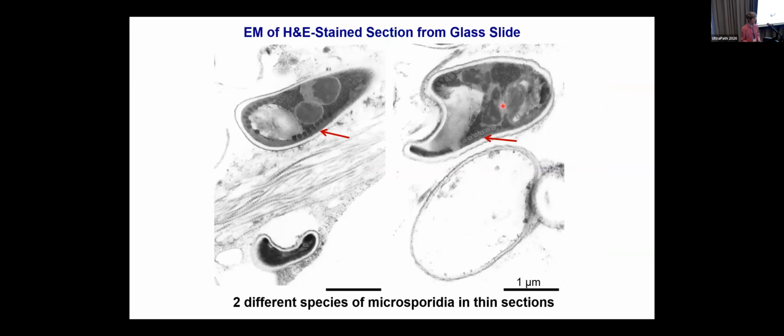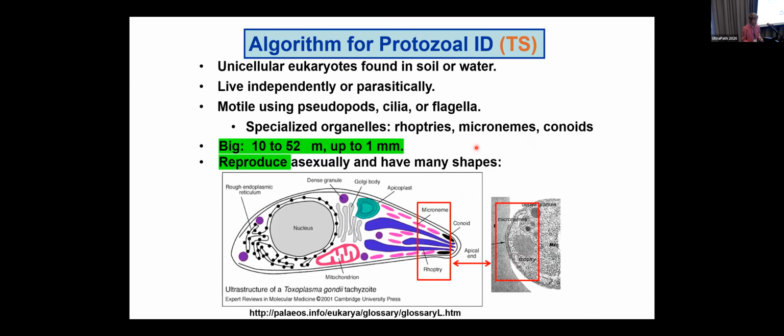Now, we had a patient, an immunosuppressed patient, a transplant patient, where we found 2 different kinds of microsporidia. And we knew that because, as you can see, one has a lot of these little saucers, and the other one has only 6. I think there's 5 on this side and 6 on that side. So that let me know, and let the physician know, that there are 2 different kinds of microsporidia in this patient. Moving on up the food chain to protozoa, they are these big things.